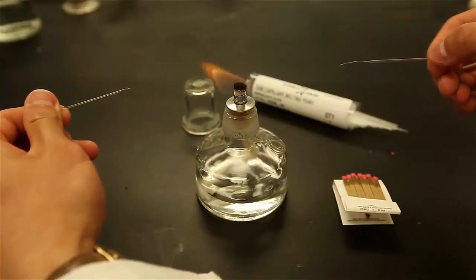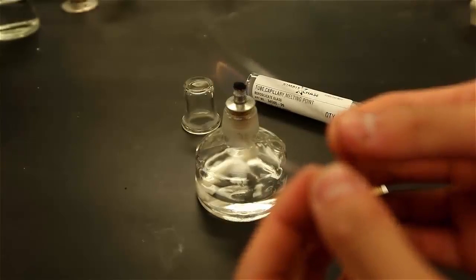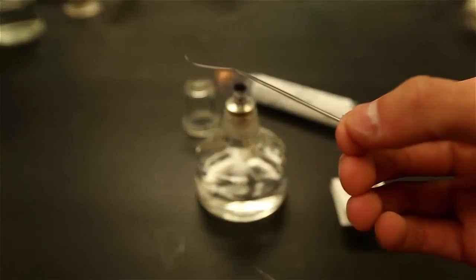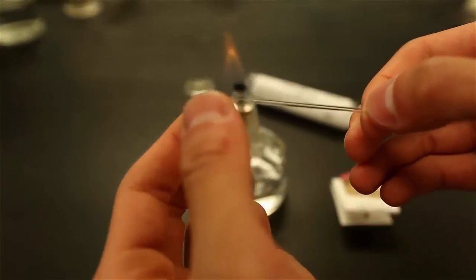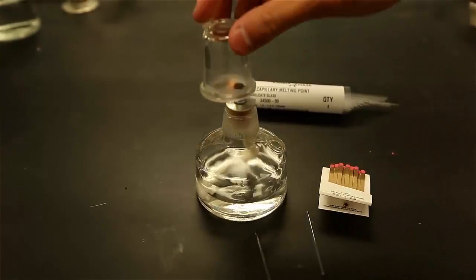Break off the excess material at the tip in order to obtain a functional microcapillary. The whole point to making these microcapillaries is to make a tube with a very small opening, because it is essential to deliver a small volume to the TLC plate. Put out the flame immediately after use if no one is using it after you.